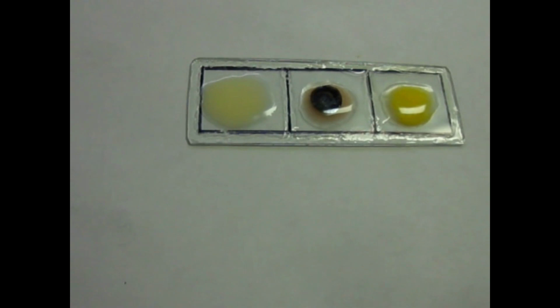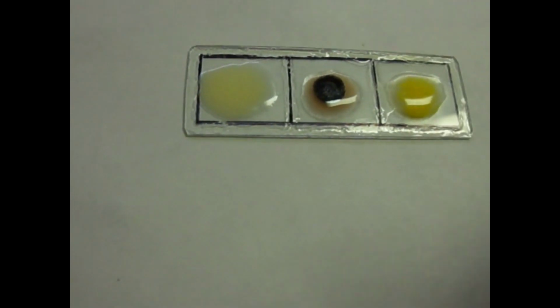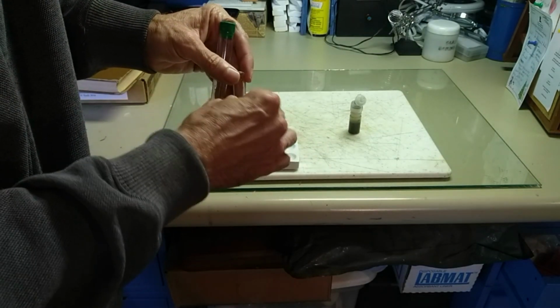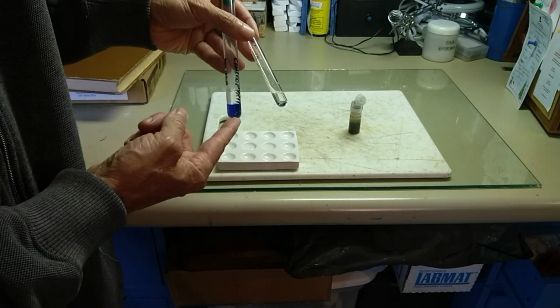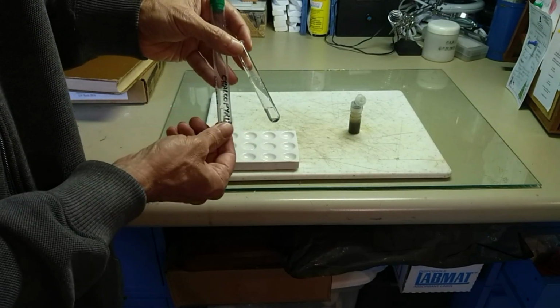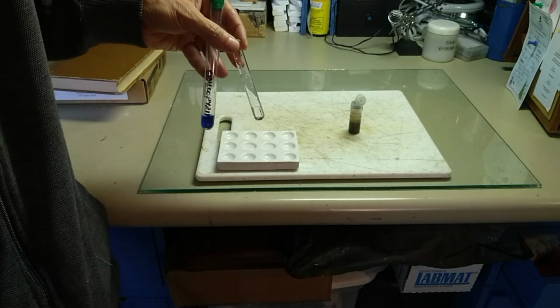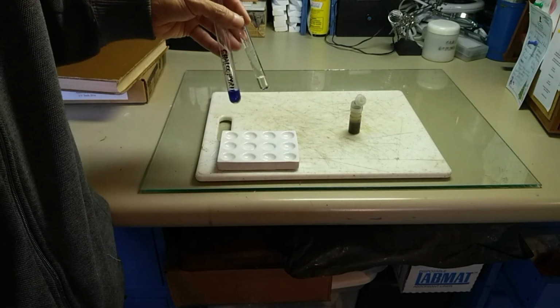So it looks like what we have here is galena, and definitely lead present here. I tested for copper. I added ammonia, and you should form some very brightly colored tetraamines like here. This is from a chalcopyrite sample that I've done before, and I got absolutely no color, so there's no copper there, so it's not chalcopyrite.